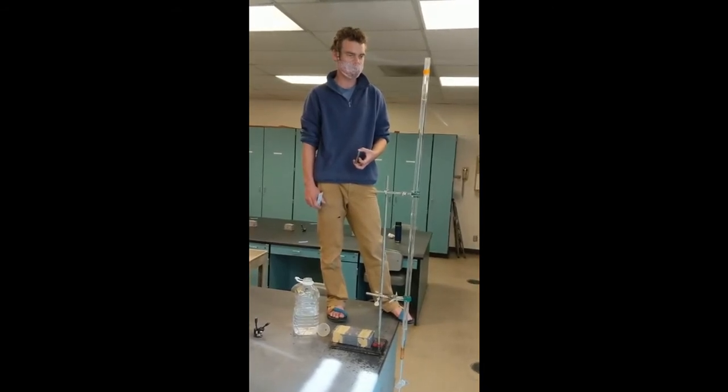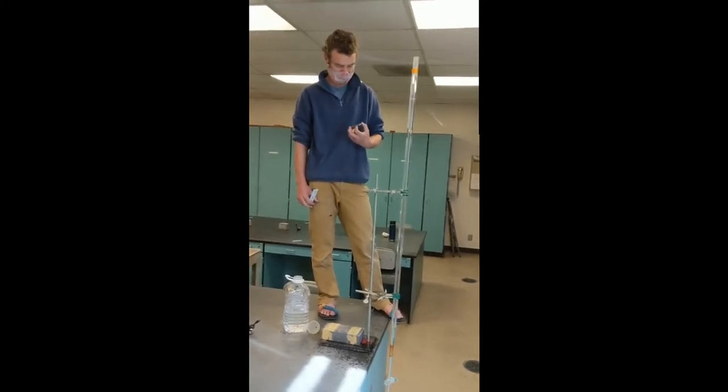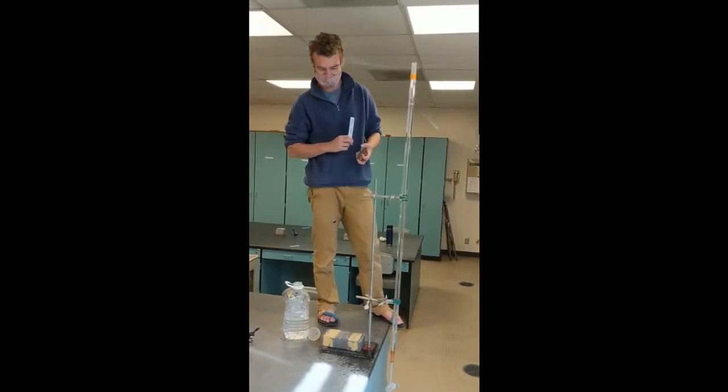In other words, do we have samples that are filled mostly with sand or mud or silt, which greatly affects the kind of organisms we find? So here's Carl to demonstrate one of our procedures for doing this.